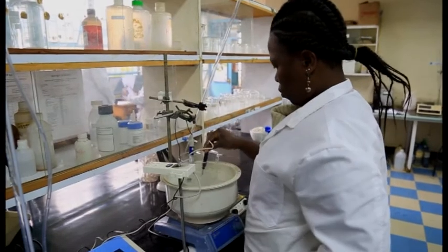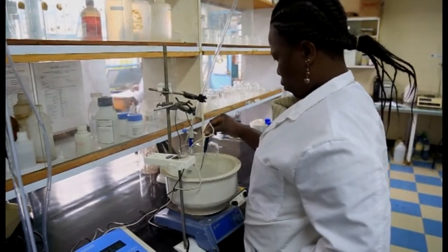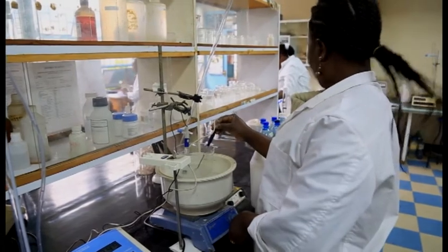Generally, in our lab, we have a number of departments and a number of labs. First, we have the wastewater laboratory, which focuses on the analysis of wastewater samples. It is a well-equipped lab which is able to handle more than 10 parameters in wastewater, ranging from BOD, biological oxygen demand, COD, which is the chemical oxygen demand, permanganate, and the other parameters which are necessary for wastewater.